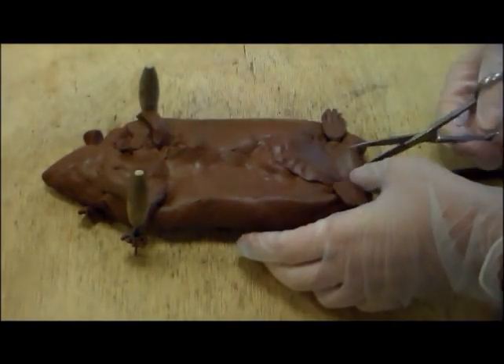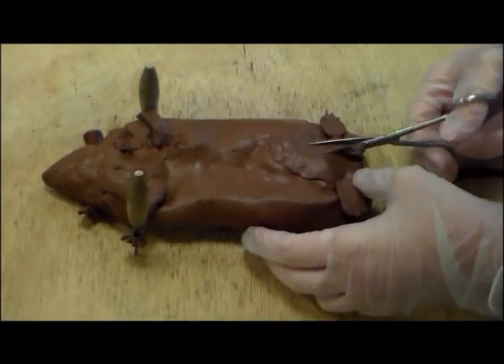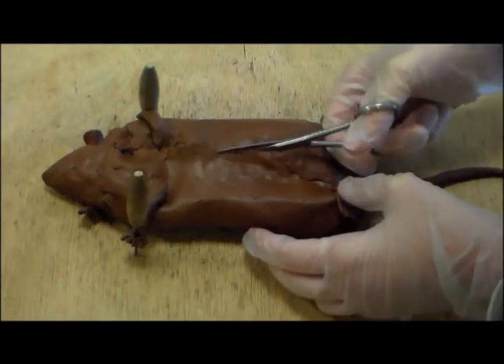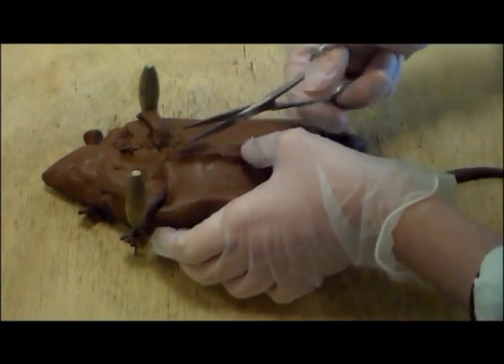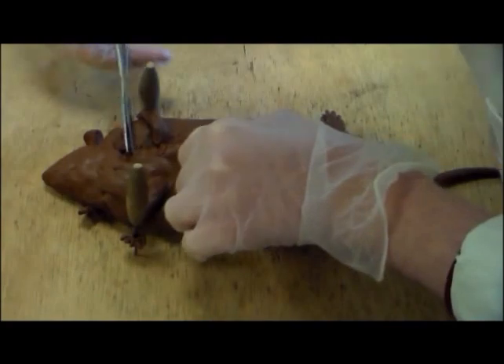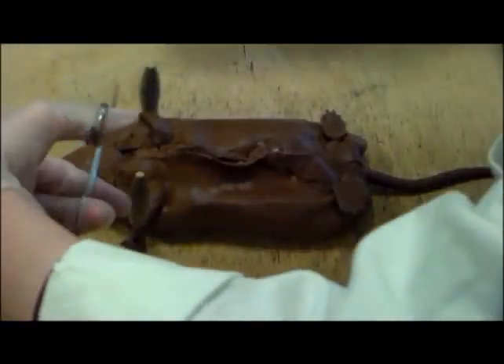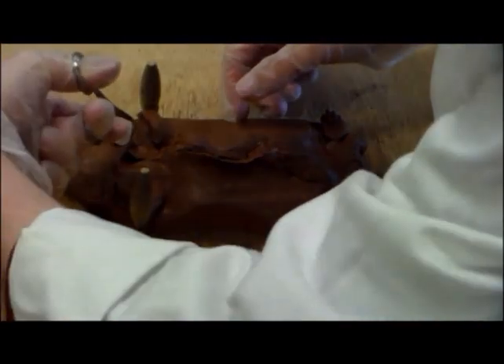Pin the rat's hands to the board. Then cut through the skin of the rat and pull the skin off.